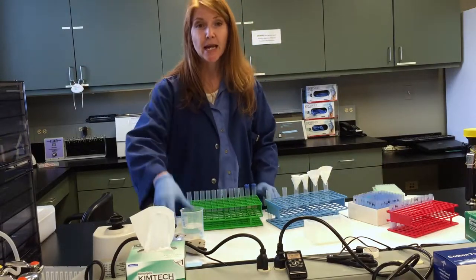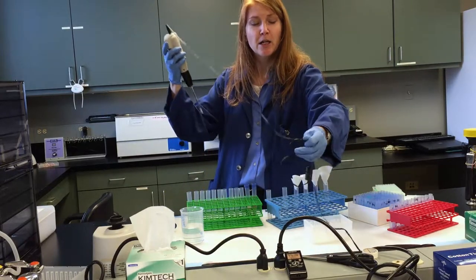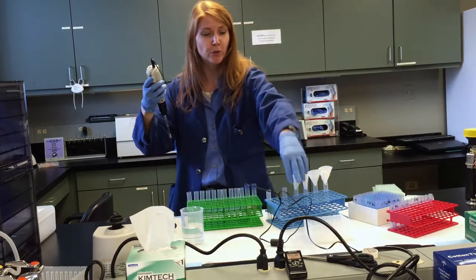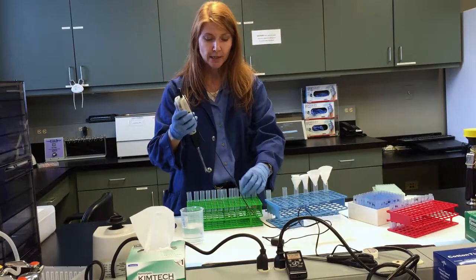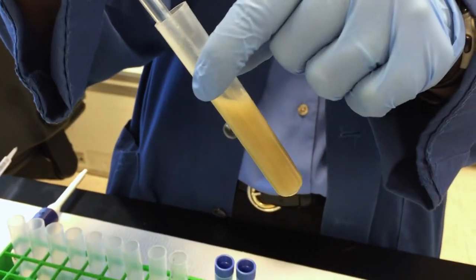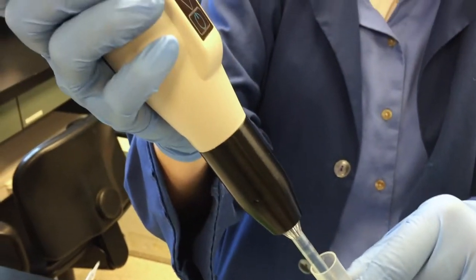Then I'm going to take a homogenizer. This is a tissue homogenizer that we have been applying to fecal hormone extractions in the field. And it's going to thoroughly mix the sample with our ethanol to extract the hormones from the feces.